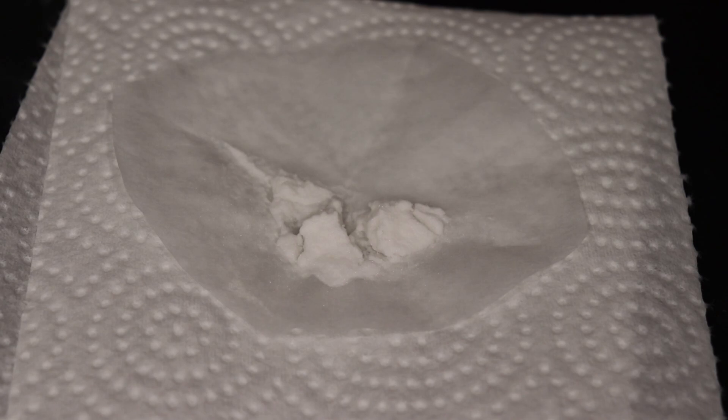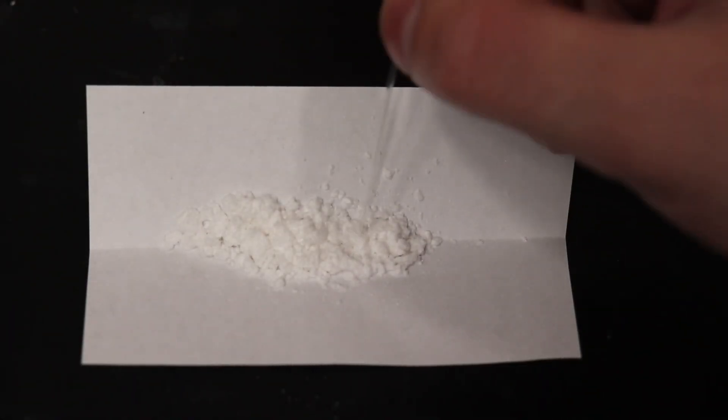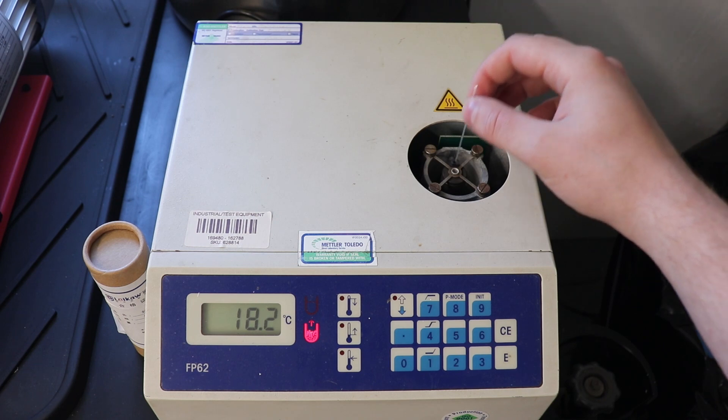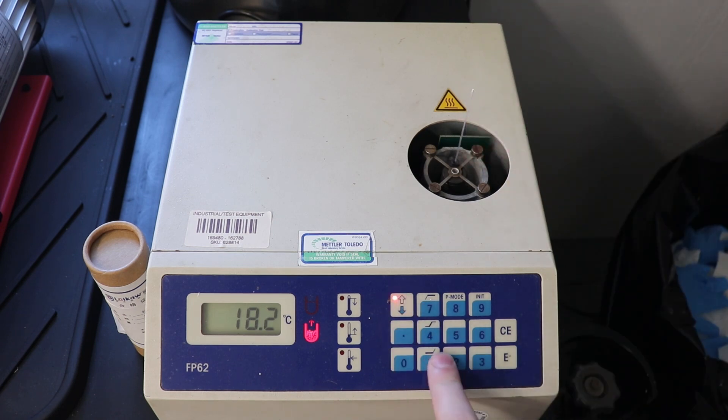The product was then allowed to air dry overnight, and the melting point was taken with an automatic optical melting point apparatus at a rate of 1 degree Celsius per minute. It found the melting point to be 146.8 degrees Celsius, with the theoretical melting point at 147 to 148 degrees Celsius.